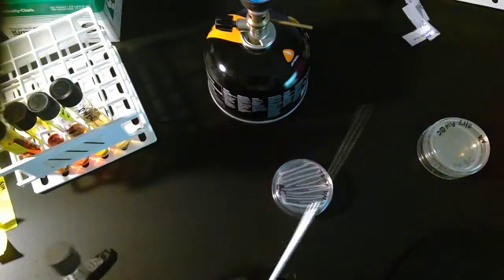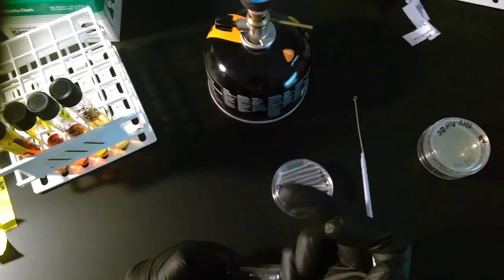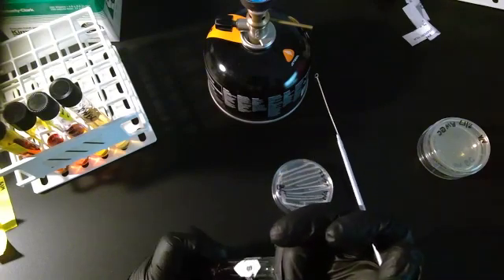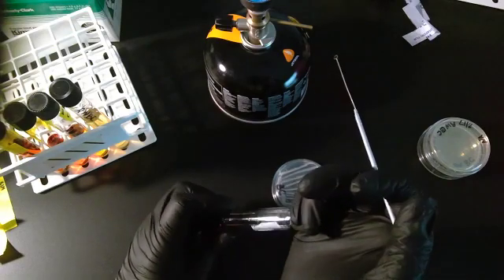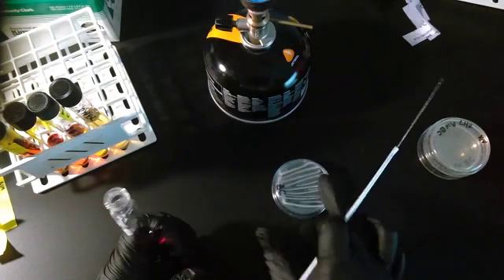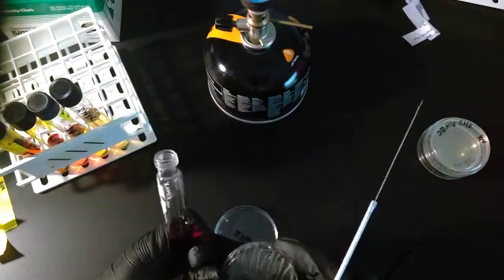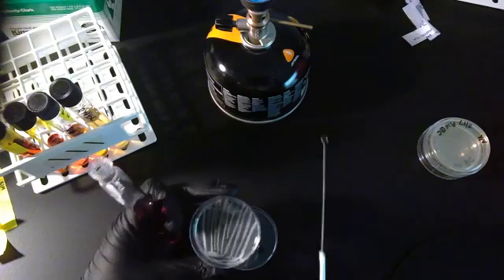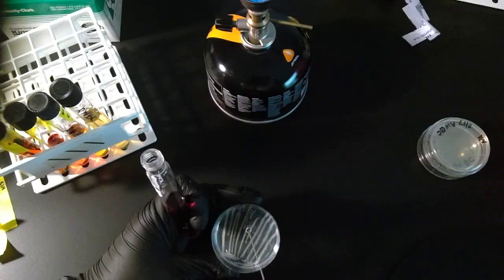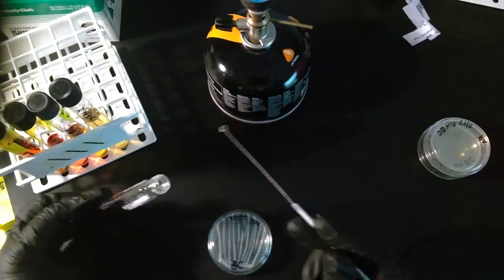I just figured that it would be easier to see on the orange tape. So, sterile loop, I'm going to hold on with my pinky, unscrew the lid. Got to clean the mouth. I've got to sterilize the mouth of the tube, so I'm going to put it through the fire a couple of times. I'm going to grab my sample. Again, get a little bit of bacteria. Got my little bit of bacteria. You can see the lump.